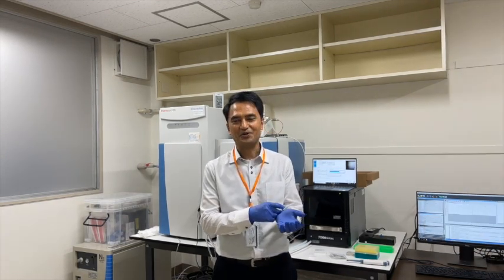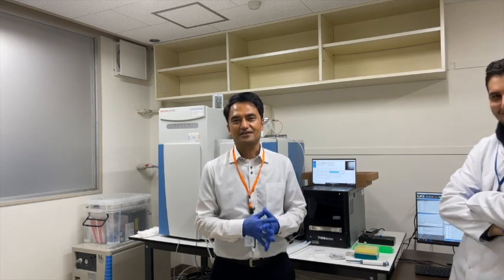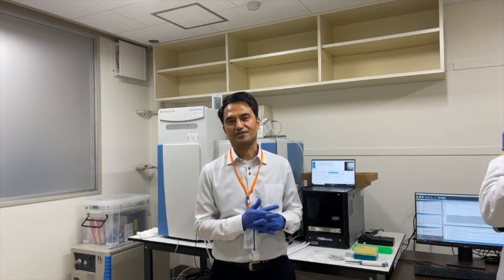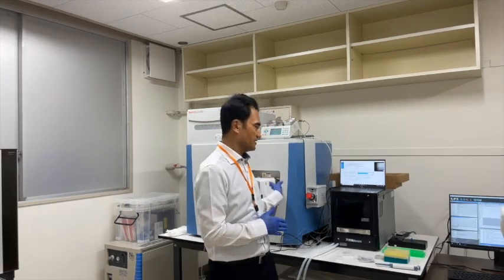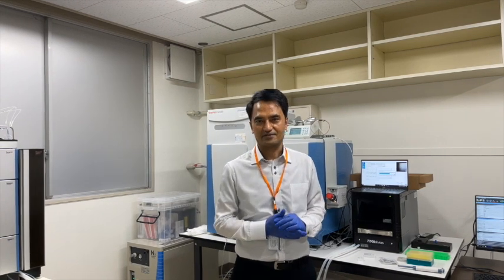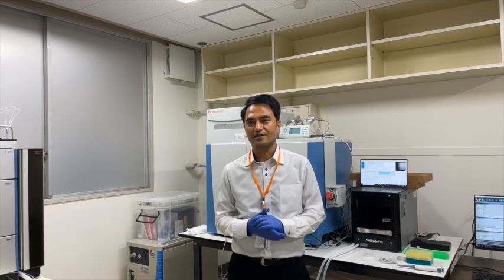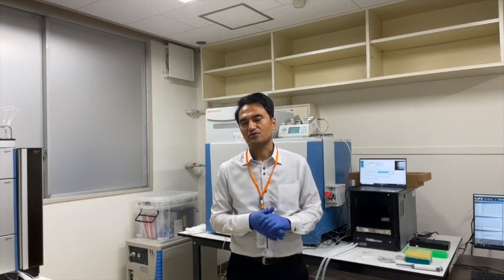This is the instrument that our lab acquired for a new project. This digital technology is the fifth one in Japan. You can see this is the technology that was developed in 2019 December.